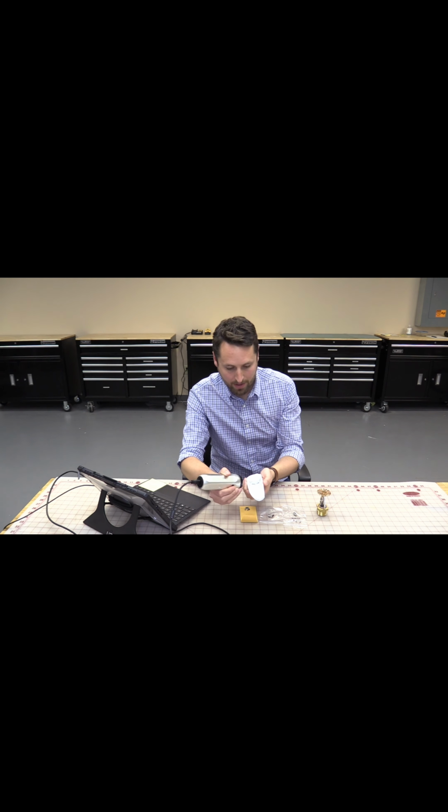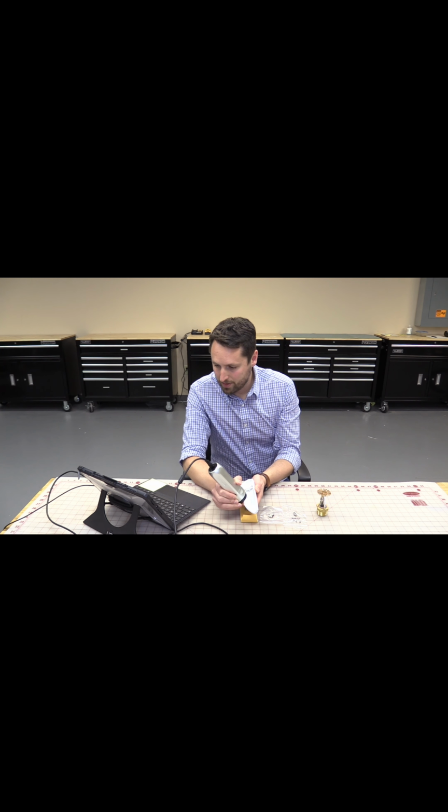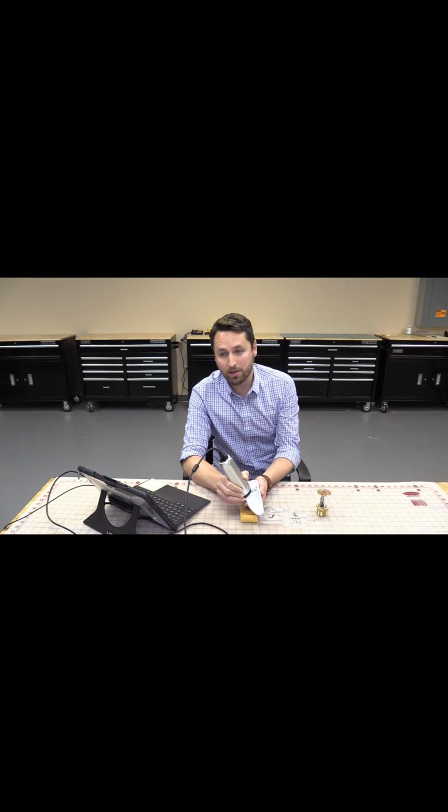Using the GelSight, very quickly and easily, we're able to see a lot of different direction on this. We see that there are radiating lines that are pointing in the downward direction. This actually tells us the direction of crack propagation, the direction that the cracks spread. All of those lines, those angles, are pointing down, and so that is pointing us towards the origin, or where the crack initiated.